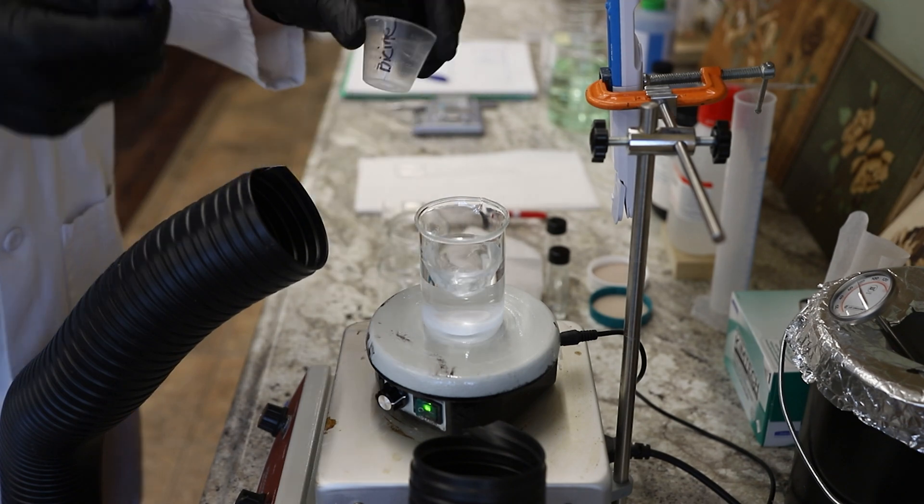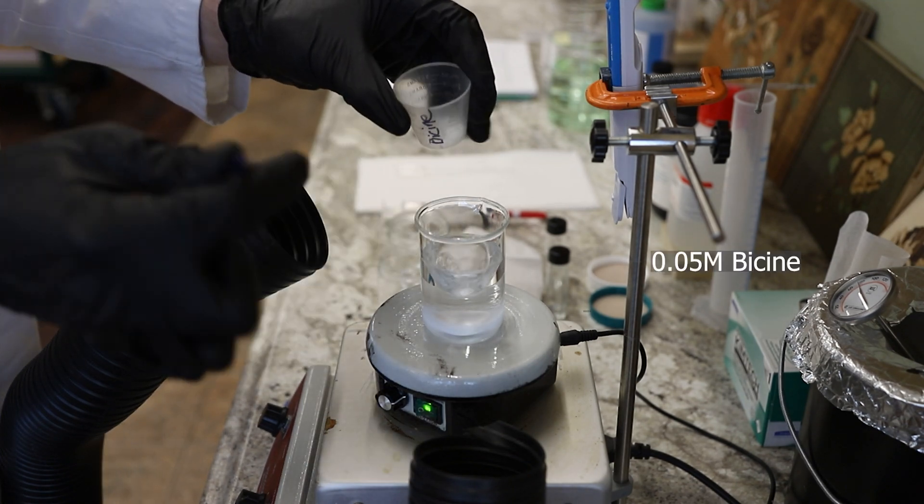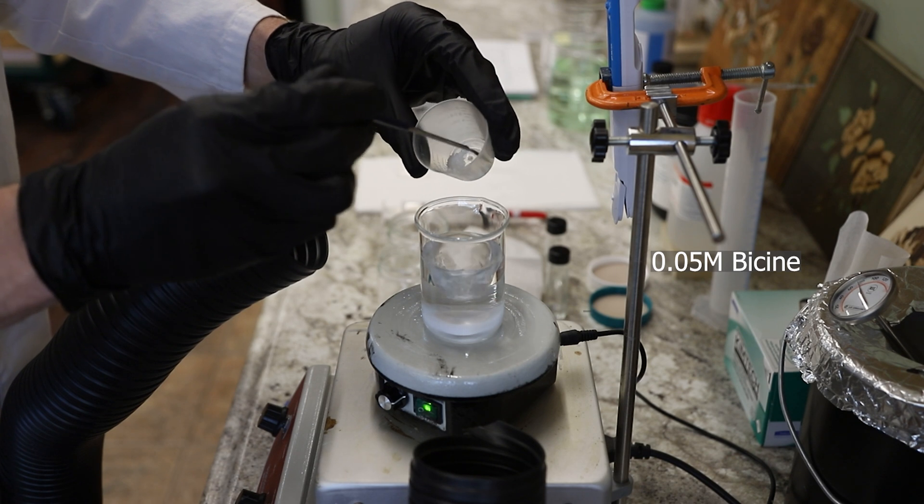Hi everybody, this is a short video on preparing nanostructured fluids, in this case a swollen micelle solution.